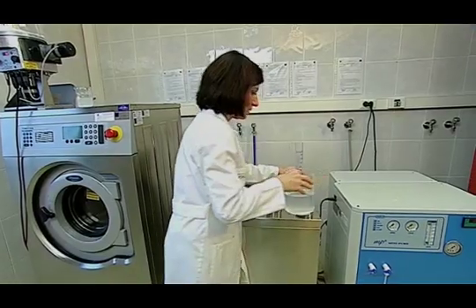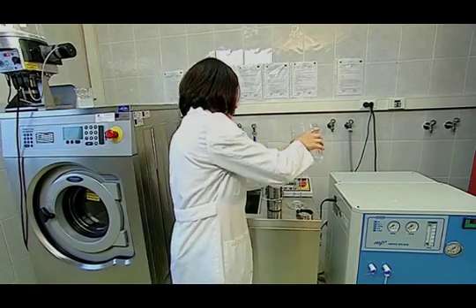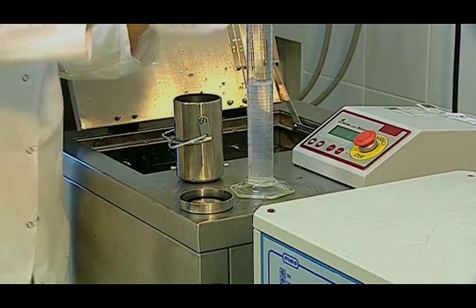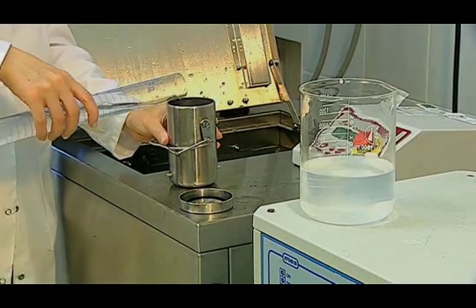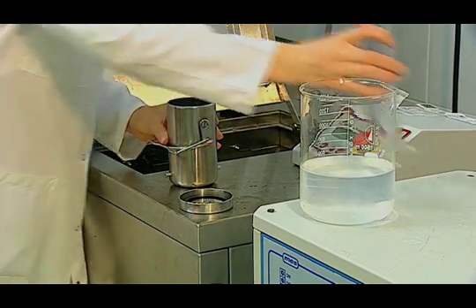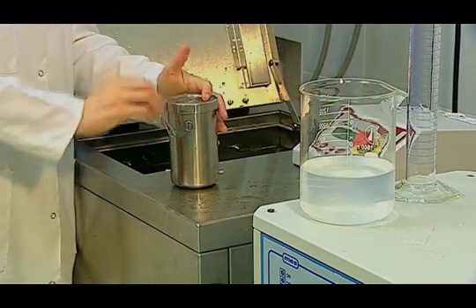The amount required for the test solution is measured at 150 milliliters with the graduated cylinder, and then it is poured into the container. The lid is closed and it is placed in a preheated device at 40 degrees centigrade.